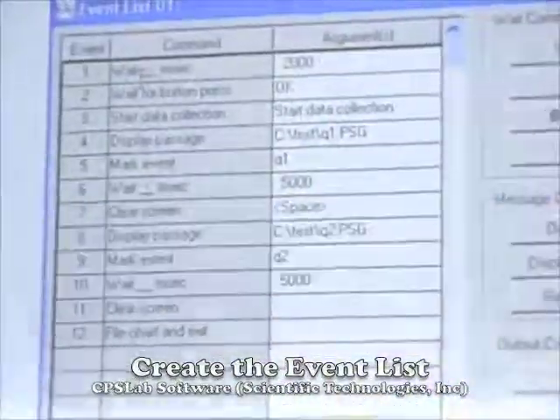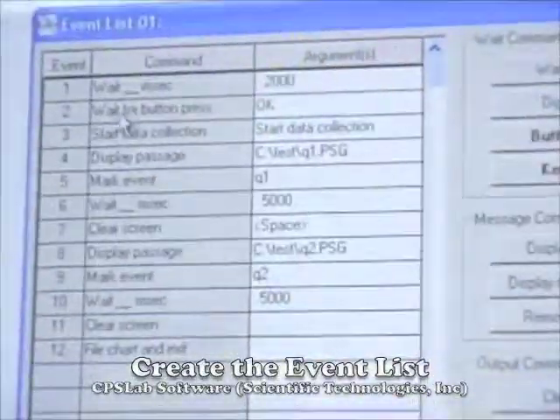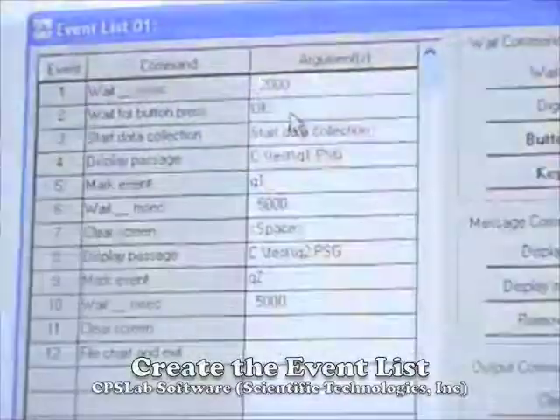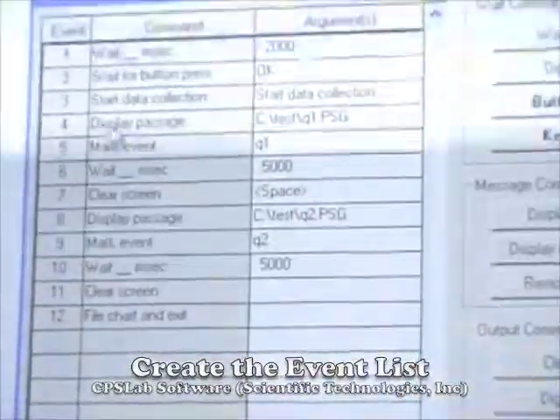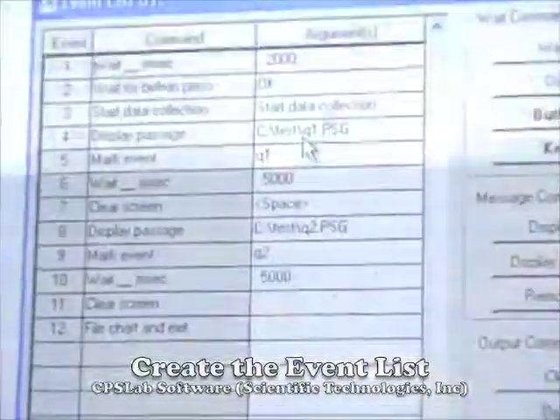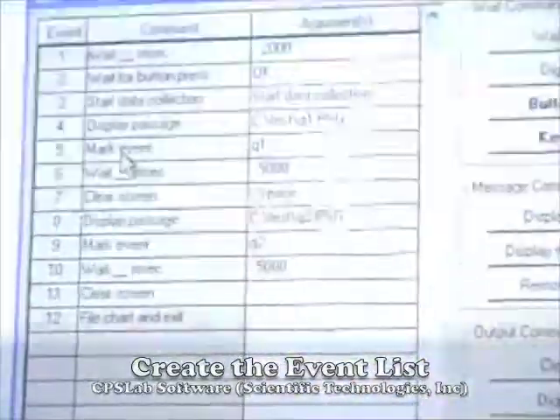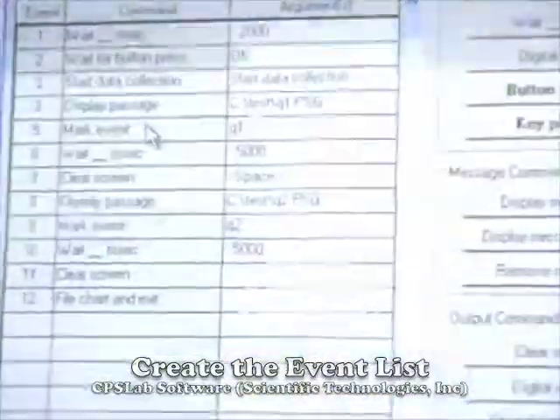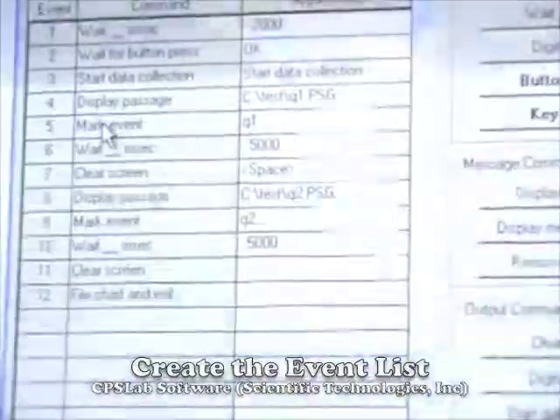So for this one, I've chosen to have the program wait for 2 seconds, and then it's going to be waiting for a button press for me, the experimenter, and then it's going to trigger the data collection, and it will present a passage to the subject, and this passage is called Q1. It's going to mark the event, so it's going to put a mark in the data file that indicates when this passage occurred. So when we analyze data, we can do it relative to when this event occurs.